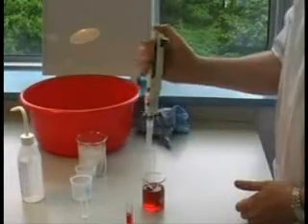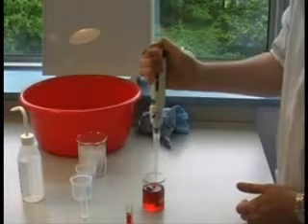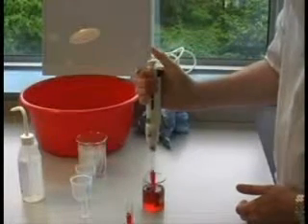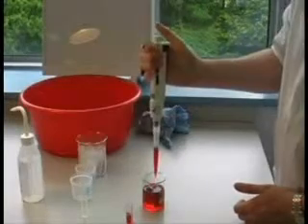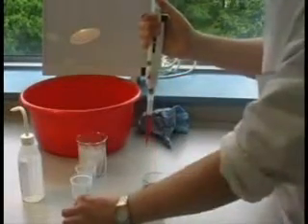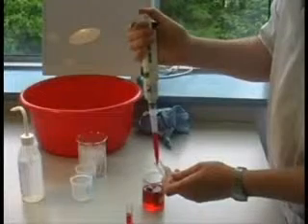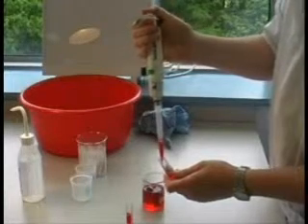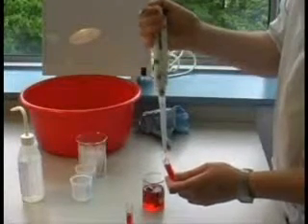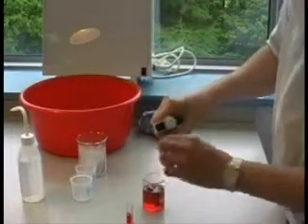It is vital to avoid going beyond the first stop when taking up your sample, as this means you will be dispensing significantly more liquid than intended. This type of common error leads to massive inaccuracies when using pipettes. To illustrate, compare the volumes of the two samples side by side — the one on the right has been collected incorrectly.